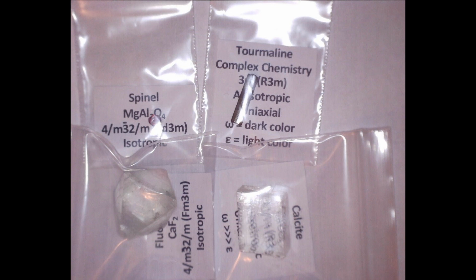With that all being said, the first experiment we want to do here is actually not going to involve our polariscope at all, and it's going to use our fluorite and calcite crystals. So we are also going to make use of a single linear polarizing light filter as well for this experiment. So if you don't have any of those, you might want to pick up the pack of linear polarizers from Snellius Minerals. We'll start by taking a look at an image through our fluorite and calcite crystals in normal everyday light.